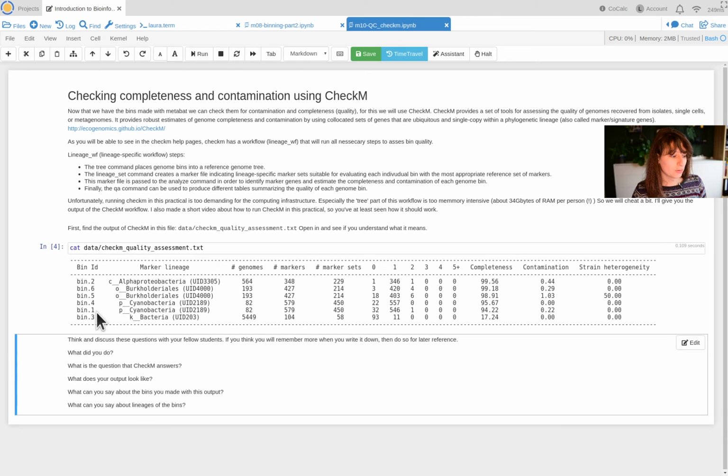So you can say about bin 1, 4, 5, 6, and 2 that they are actually really good. Go analyze these any way you want, and you can be very content. Bin 3, you may want to throw that out. You don't know what's in there.